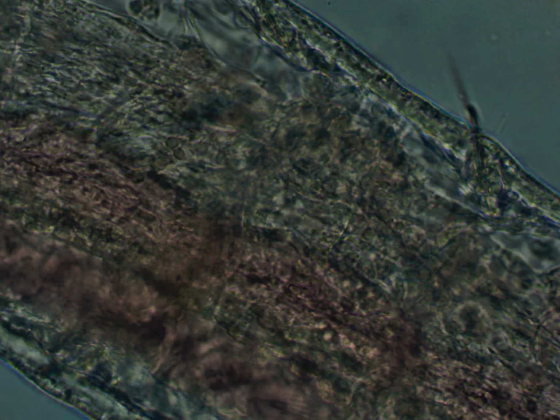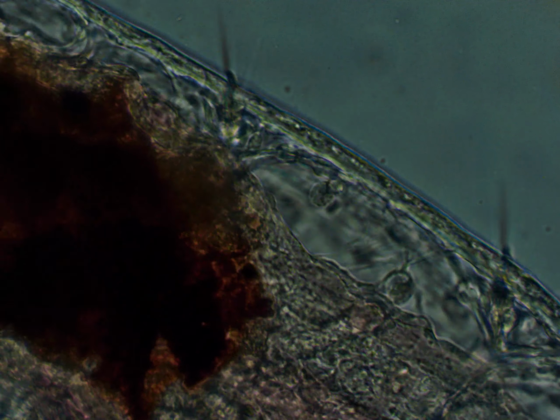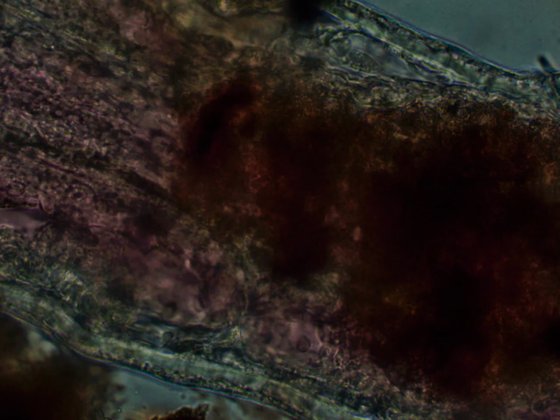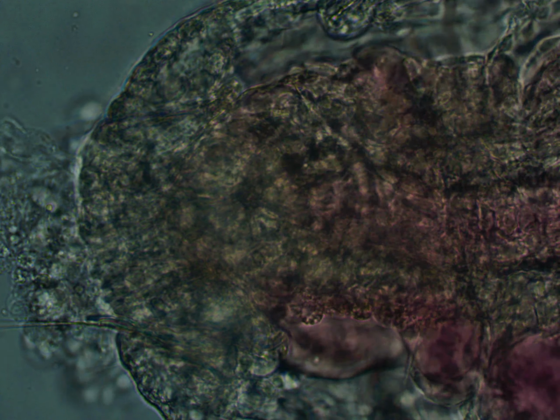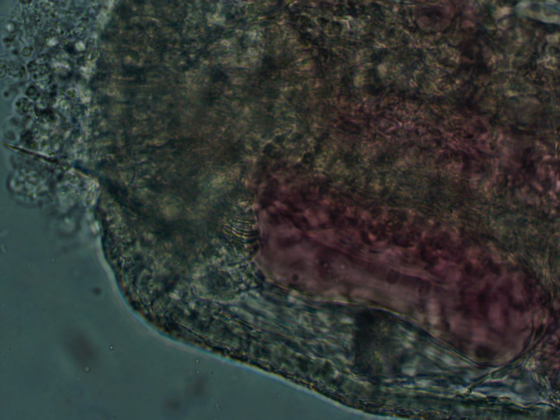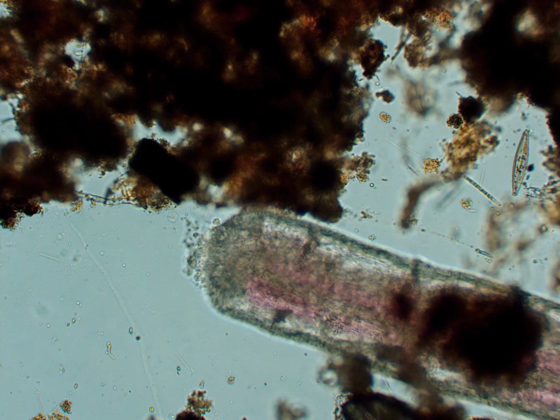And you can see those bristles coming off, which is another feature of annelid worms. They have those bristles which help them move along with their segments. It's how they grasp onto things easier. Those are also on things like earthworms, for example, which are annelids. And here is what its head looks like. It has a lot of organs around its head, and it has a few bristles on this top segment.